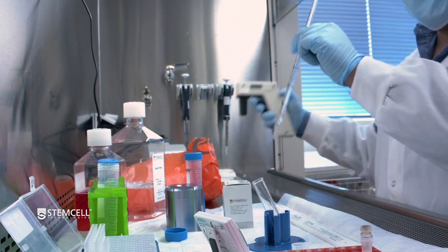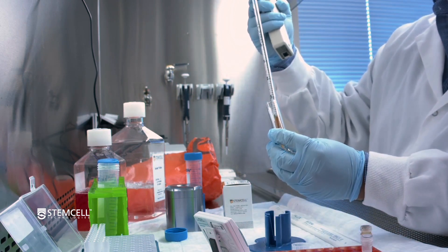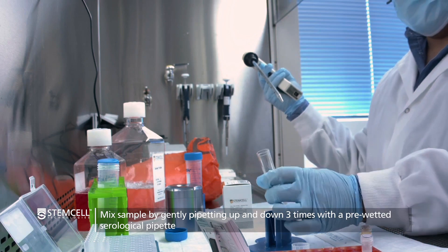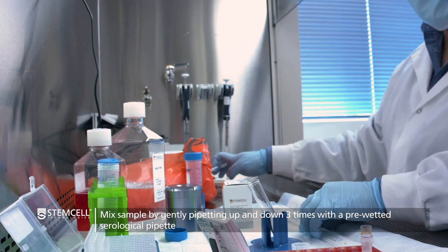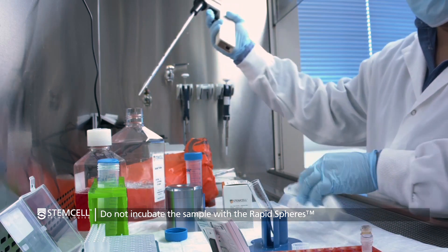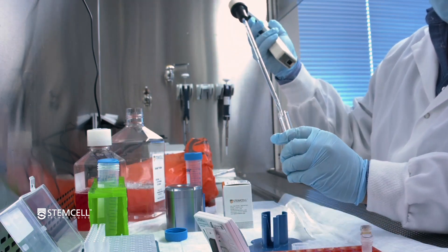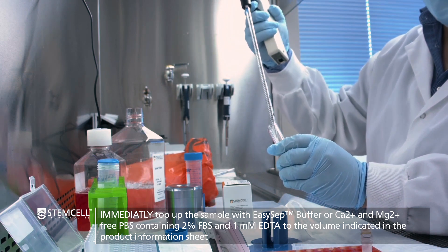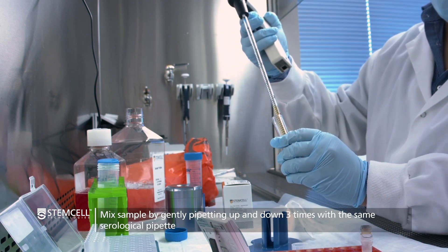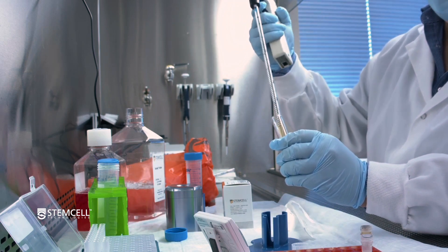As hinted to earlier, you could have saved the previous pipette optionally, and this will allow for a more thorough mix — definitely a good consideration if you're working with larger volumes. Be mindful of elapsed time because you want to minimize any incubation of the particles with the cells. Proceed to top this up — in this case we are adding 4 ml of EasySep buffer. The instructions on the 17955 information sheet say that for start volumes less than 4 ml, you top up to 5 ml. If starting with more than 4 ml, you'd top up to 10 ml.